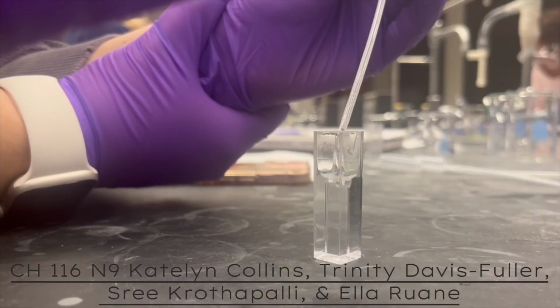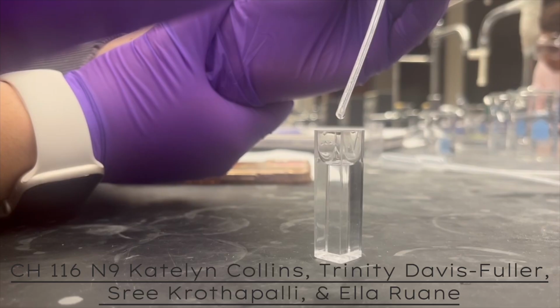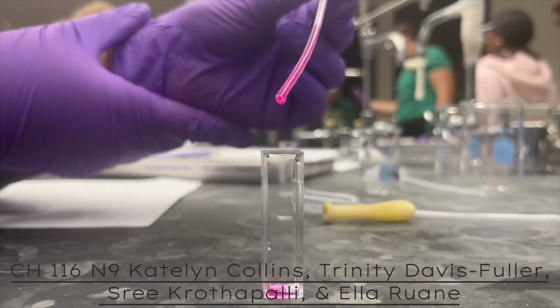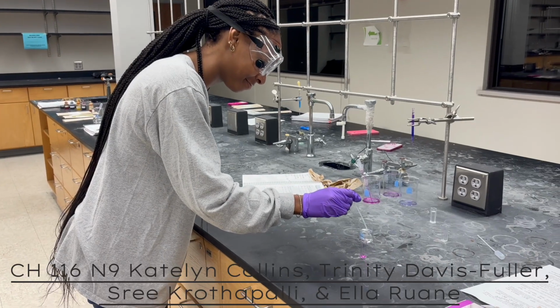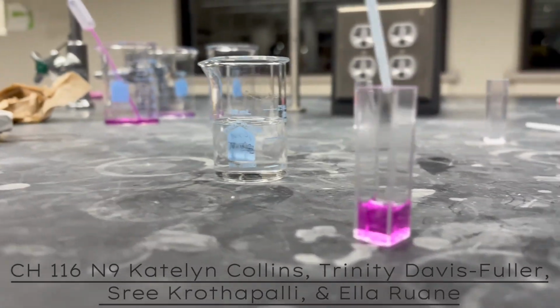Using a pipette, transfer the solvent used to prepare the solutions and the two solutions into cuvettes that are clean, dry, and scratch-free, ensuring that the meniscus rests perfectly on the fill line. When analyzing a colored solution, ensure that you scan across all wavelengths. In this specific experiment, the appropriate range is 200 to 800 nanometers.